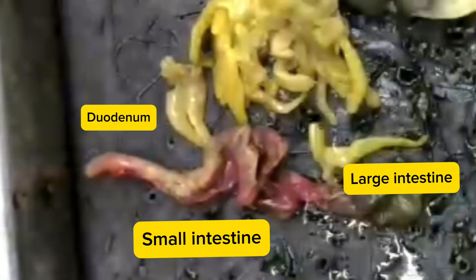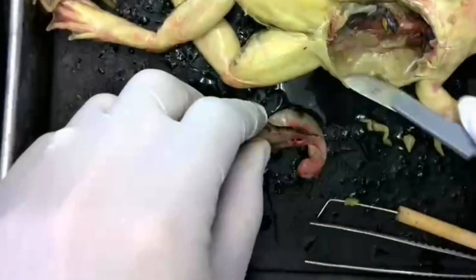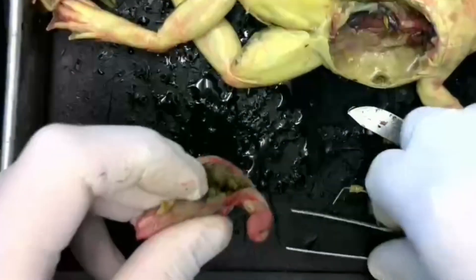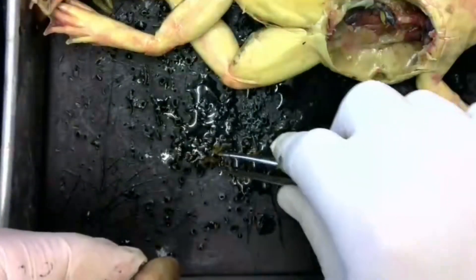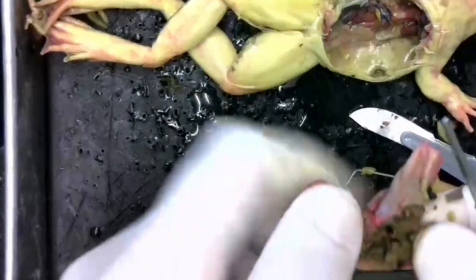We have the small intestine and large intestine. We'll cut open the stomach. As frogs eat their food whole, we'll be able to see what their last meal was — possibly a fly or part of a fly. The rest of the stomach contents appear to be pretty empty.